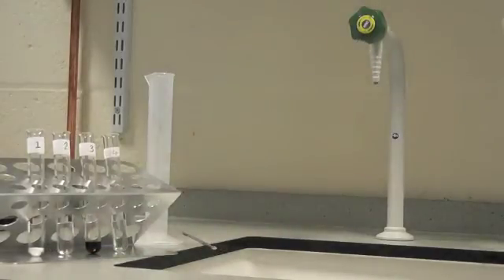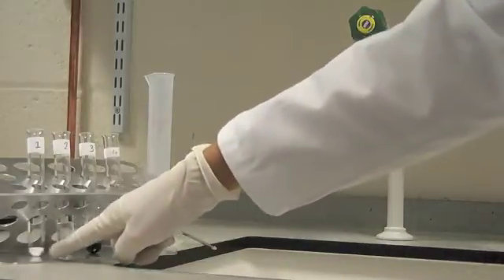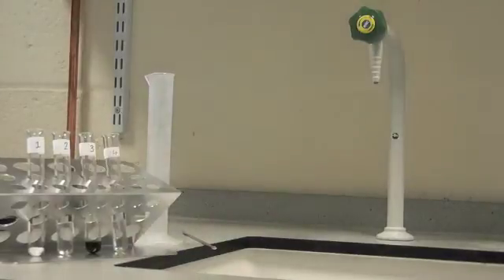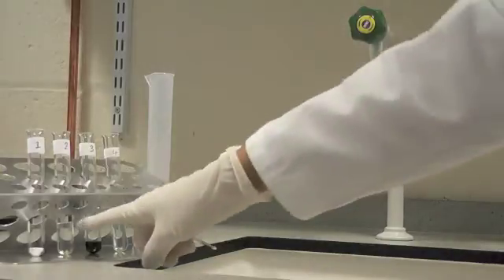Put two gram spatula measures of sodium carbonate into test tube one. Put five centimetre cubed of water into test tube two.